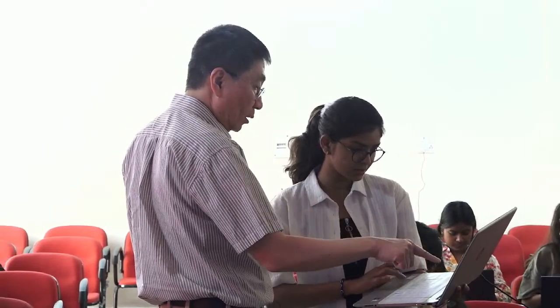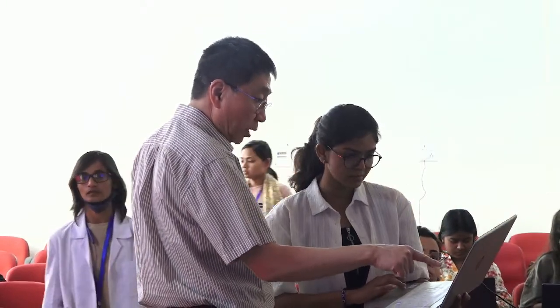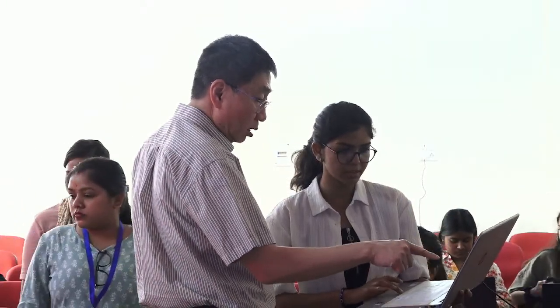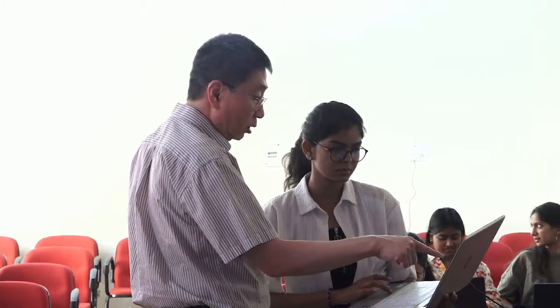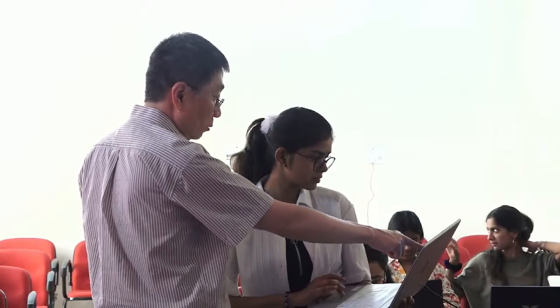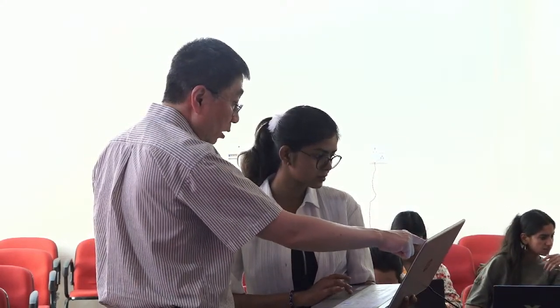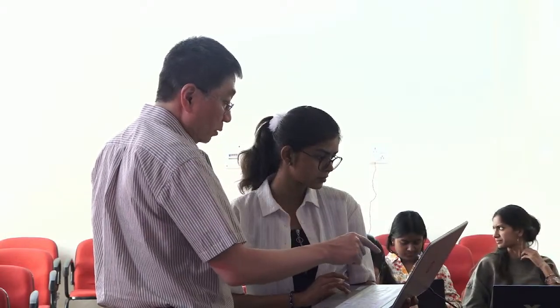You build, so you add a residue. Add terminal residue to it. So where's your menu bar? I'm not getting anything here. Which version of Coot is this? 0.9? You don't have a menu bar? You do. So go to Edit, Preferences, bottom, and then Refinement Toolbar. Yes, Icon and Text. Okay, there you go. So now you can add that.